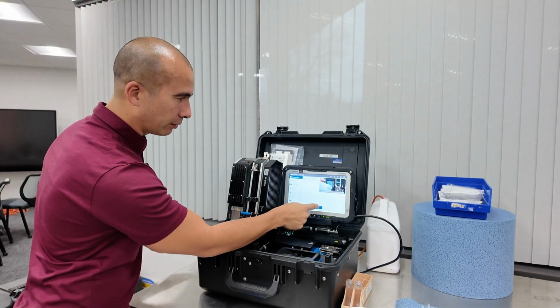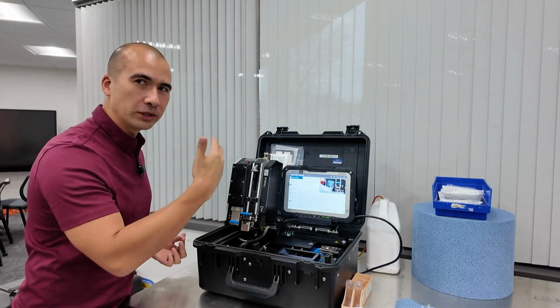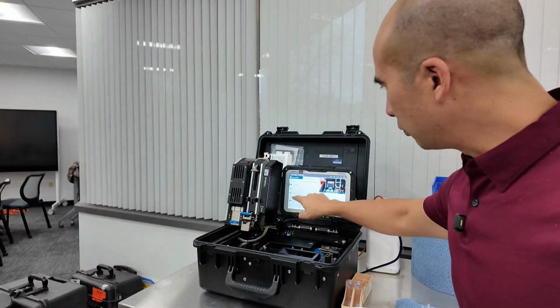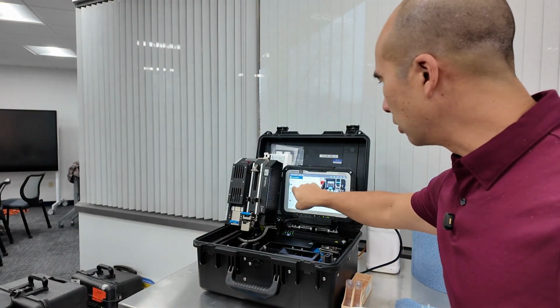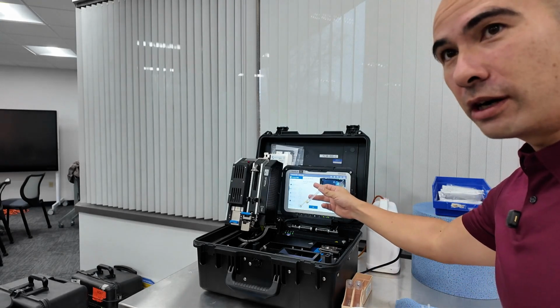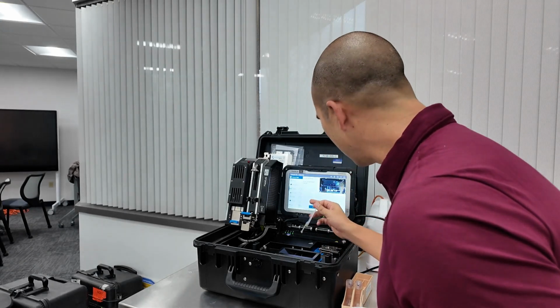And then we press 0. Okay, so that's going to go on in the background while we're doing some of the other tests. So now that we've stepped through, the idea is to go to viscosity. Now it says the viscometer is already ready, so we can press start and insert the sample.